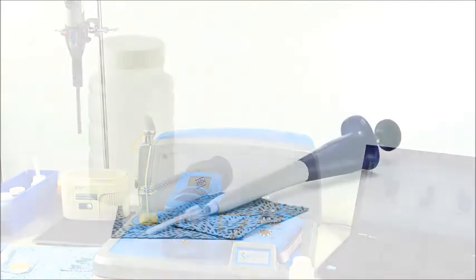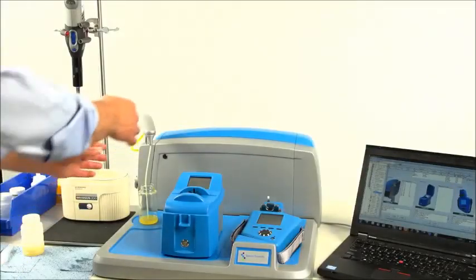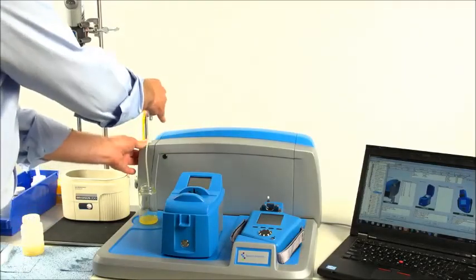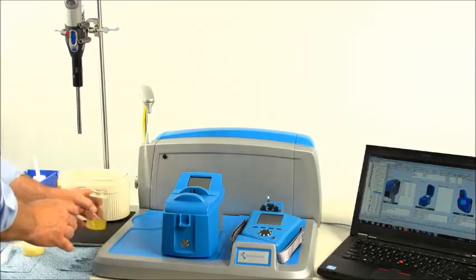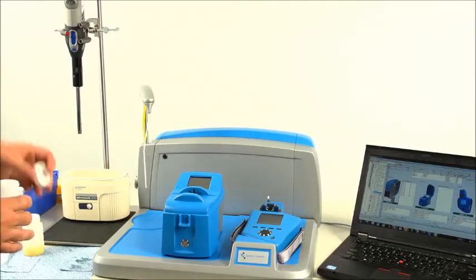The LNF can process undiluted samples up to 320 centistokes. For heavier oils, a simple dilution can be made using the standard Mini Lab 53 consumables. Once the sample is processed in the LNF, you flush with solvent, typically using either Electron 22 or lamp oil.